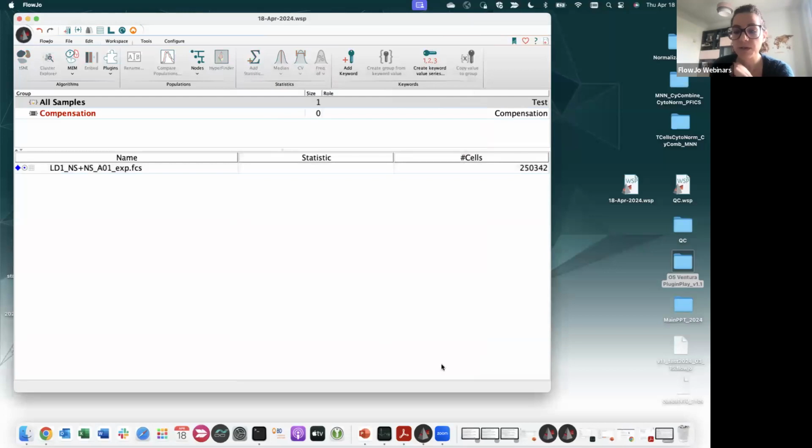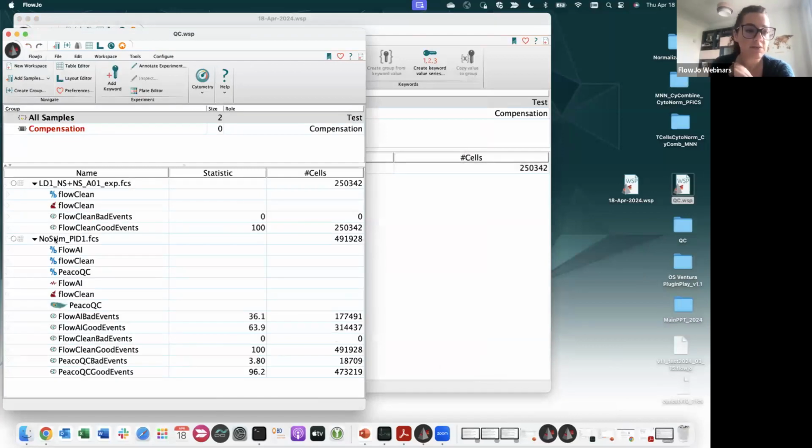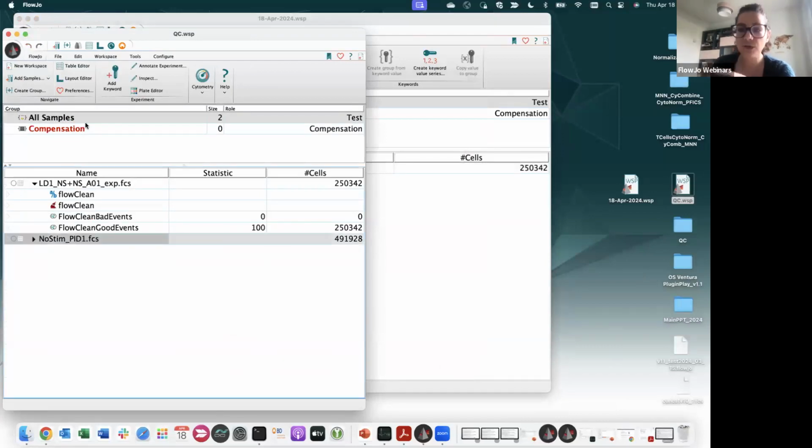Now, for the sake of time, I have made another workspace right here, but I will show you how to use all the algorithms anyway. And as you can see, I have a FlowClean bad events and FlowClean good events. So in this file specifically, these are training files, honestly, there were 0% of events removed.